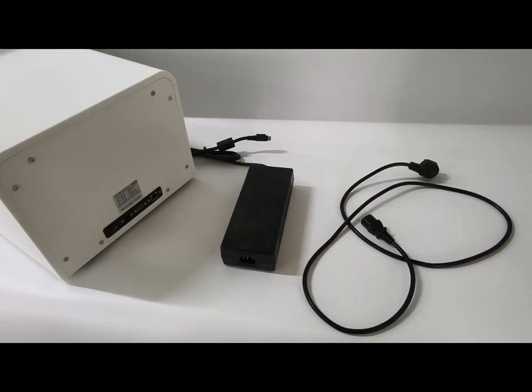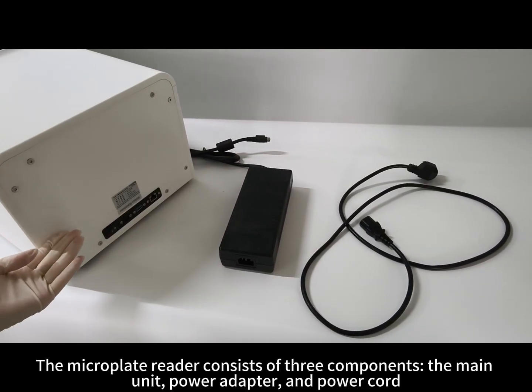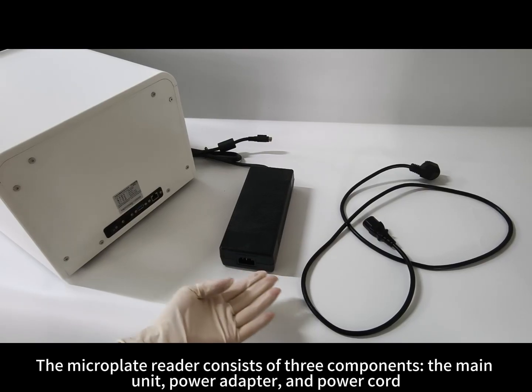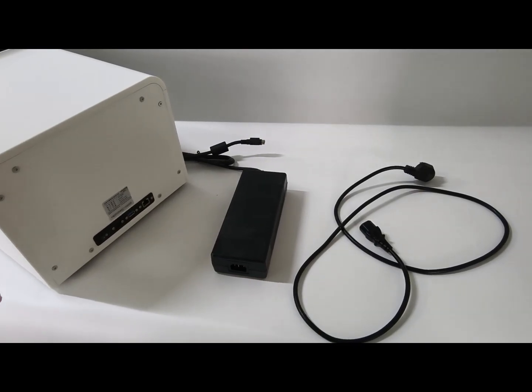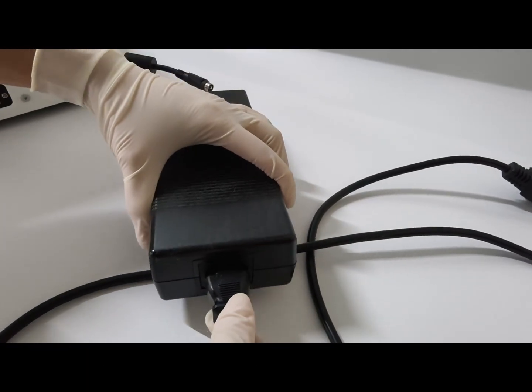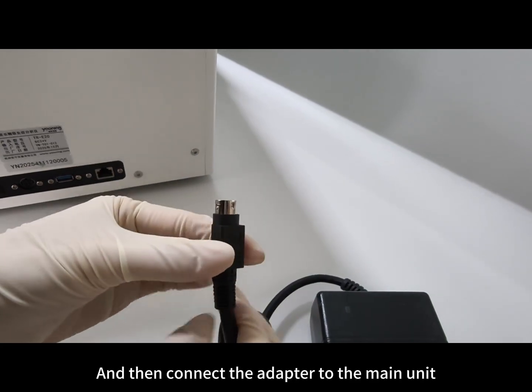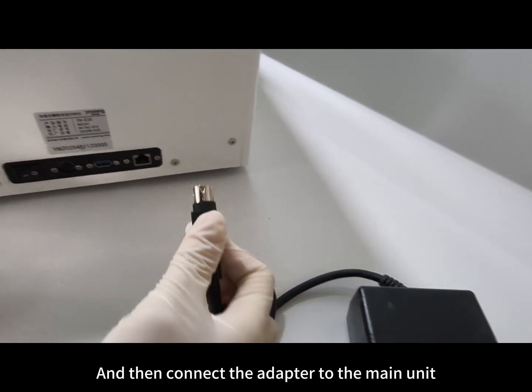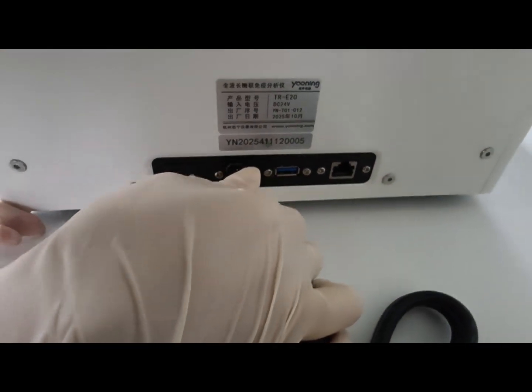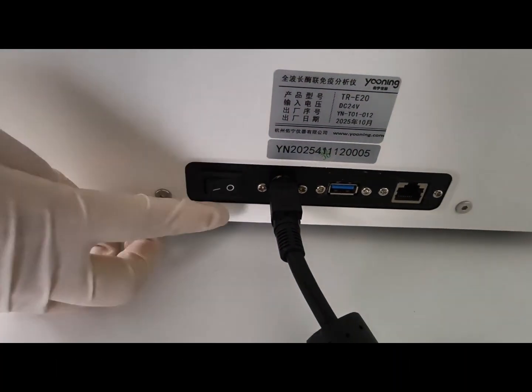Instrument Startup. The Microplate Reader consists of three components: the main unit, power adapter, and power cord. Connect the power adapter to the power cord, and then connect the adapter to the main unit. Plug in the power and press the power button on the instrument.